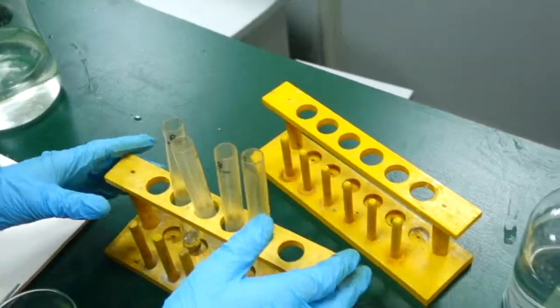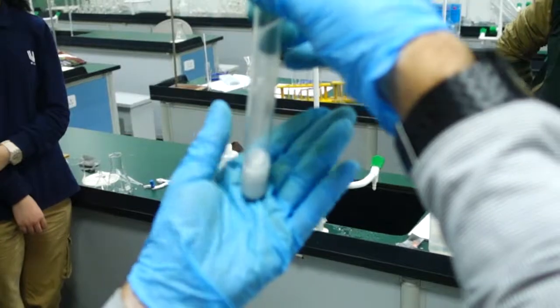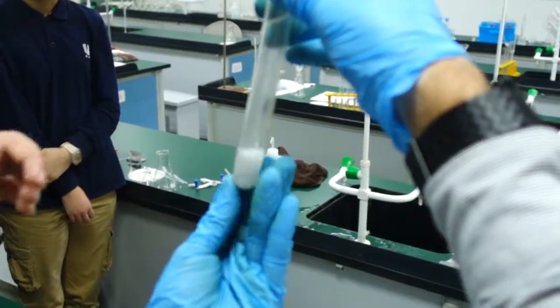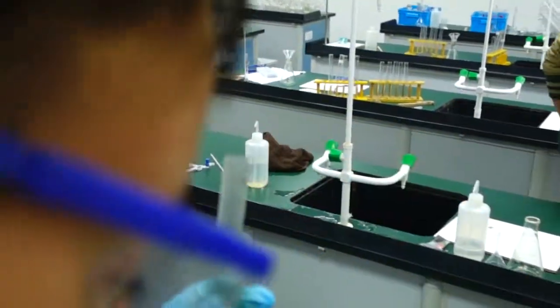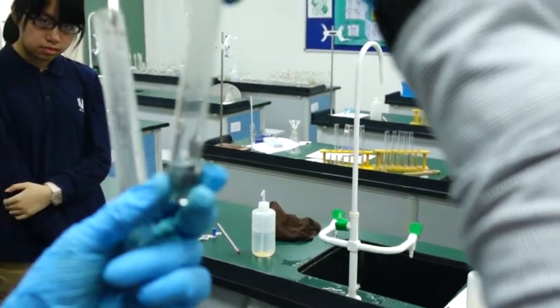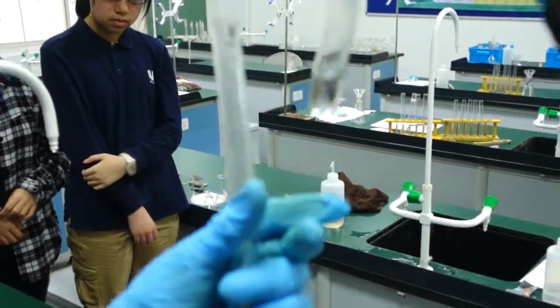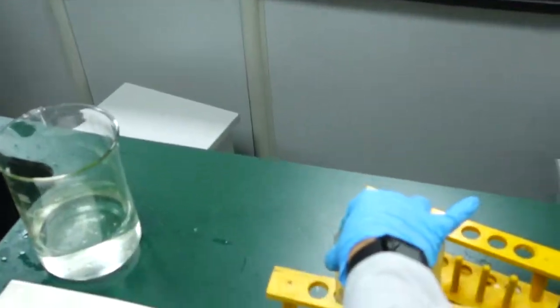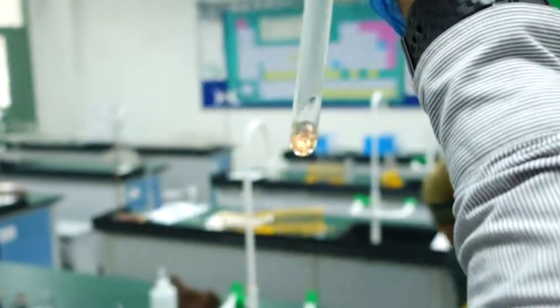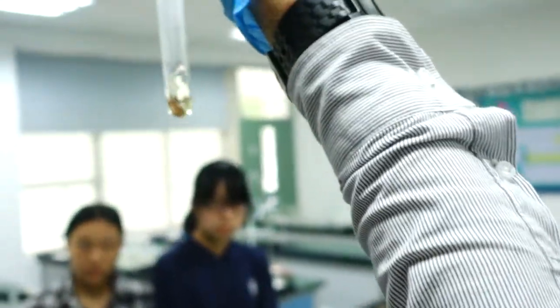Let's just leave these. Oh look at this one - this is metal A. You can feel it, it's quite hot. I think metal D is dead, very much dead. You just have some black solid left. And this one - does the liquid look colored to you? It looks a little bit colored to me. A little bit yellow or green? Green.